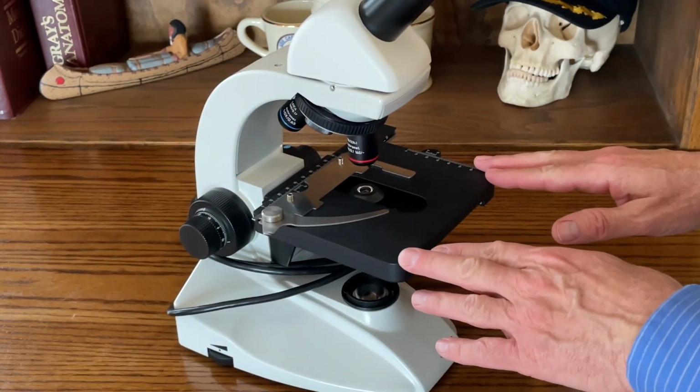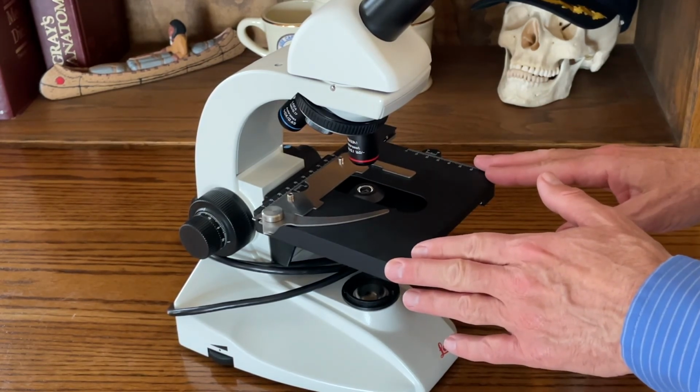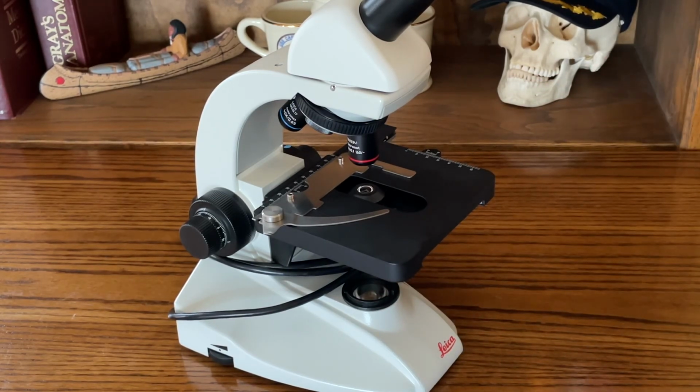And there you go. So that is the light microscope, the parts and fundamental use of this scope, the easiest way to locate your tissue sample within the slide.